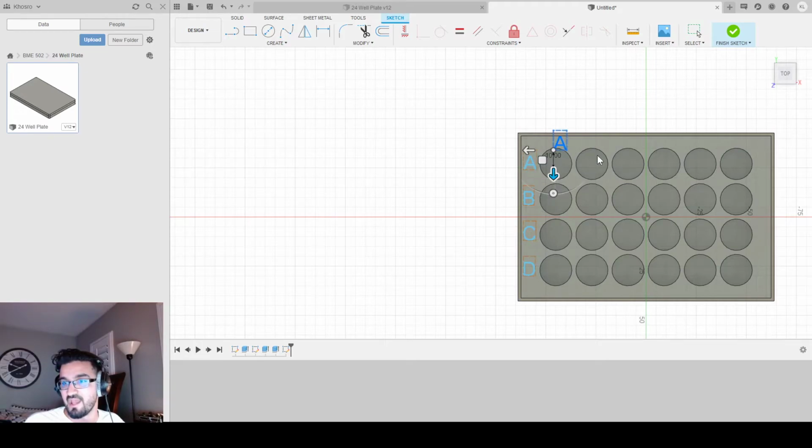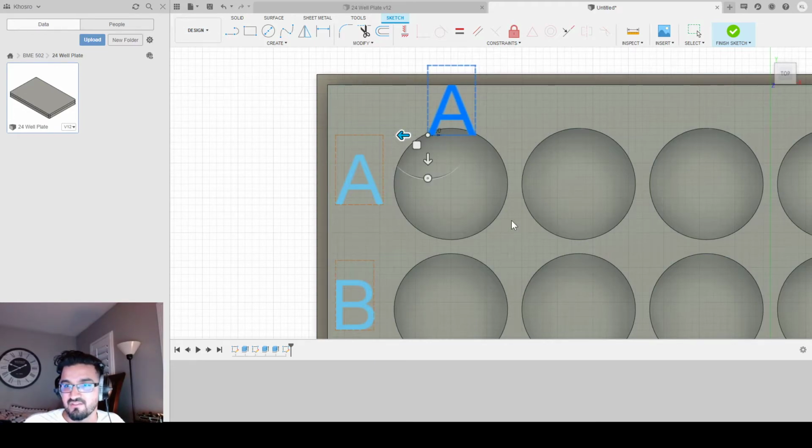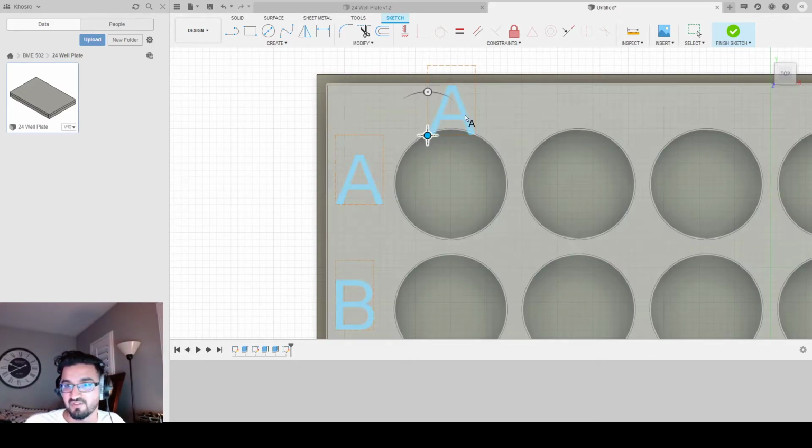drag it up, and you're going to notice that the letter is too big, and that's usually the case with 24 well plates. The numbers are smaller than the letters, and that's okay. We'll fix that in a sec. What we're worried about now is we got to kind of center this. So this is about center for me, for my eyes, right? Doesn't matter, doesn't have to be perfect.